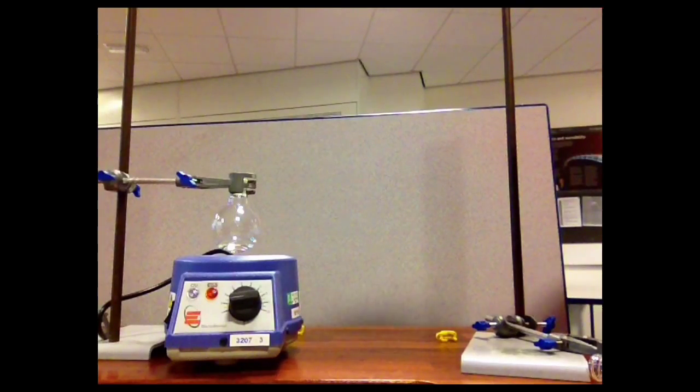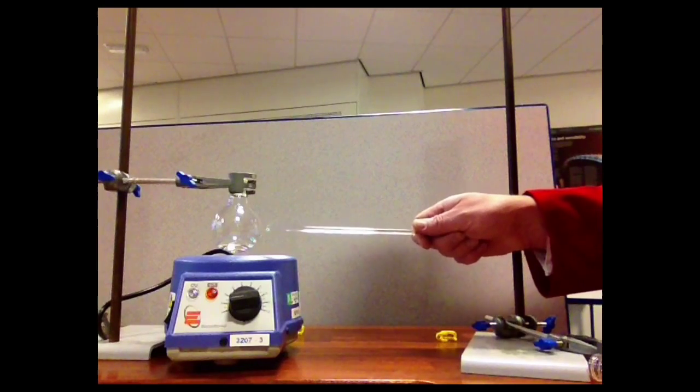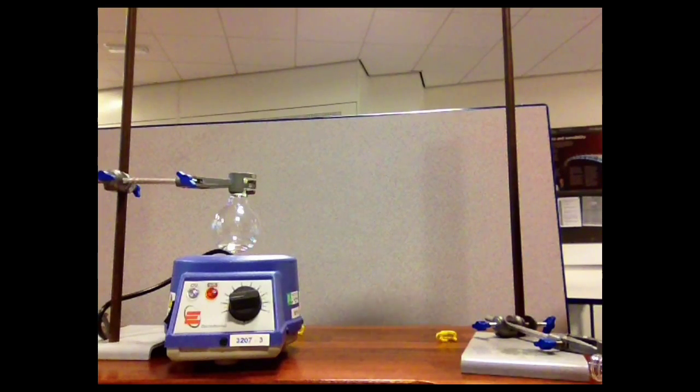In distillation, the impure product is placed into a glass flask. In this case, it's a round-bottomed flask because it's got a round bottom. There's also a flask called a pear-shaped flask, which comes down to a bit more of a point at the base. As well as the liquid, you'll add some little granules called anti-bumping granules. This is an inert material that just provides a surface for bubbles to form during the boiling and makes the boiling process smoother and less likely to splash material up out of the flask.